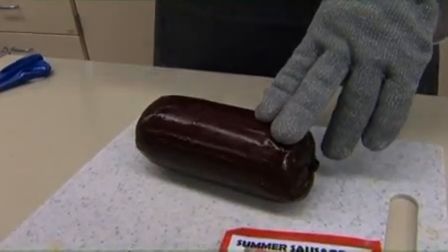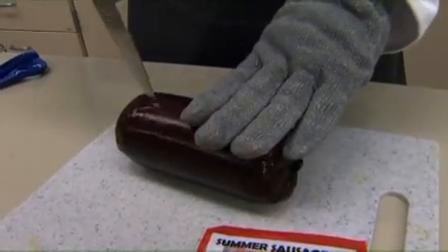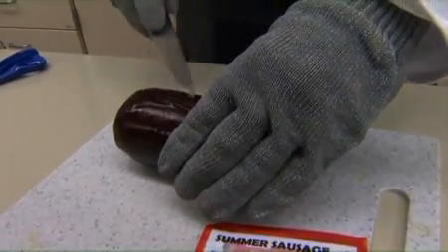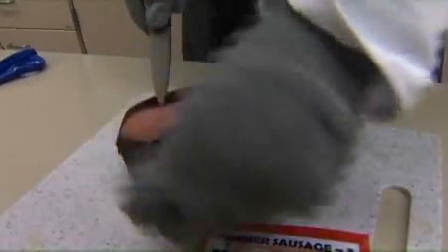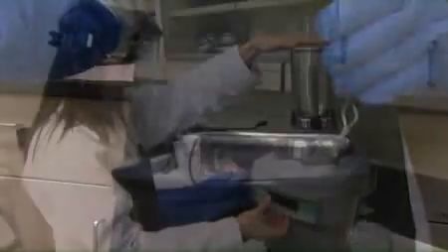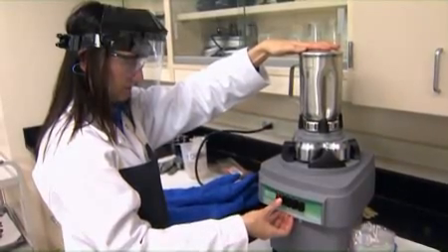Next, we will demonstrate the preparation of a summer sausage sample. Sausage is prepared in a similar manner as the previous meat sample. When applicable, carefully remove the sausage casing by using a knife and cutting board. Cut the sausage into small pieces and homogenize by using the liquid nitrogen and blender method previously described with the meat sample. Samples should be stored in a freezer and remain frozen until use.